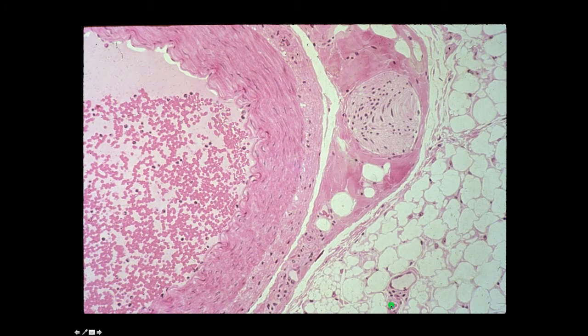Here is a peripheral nerve with some surrounding connective tissue, a lot of fat shown here, some small blood vessels, maybe an artery and a small vein here, and then a larger artery shown here. And in this larger artery, you can clearly identify something called the tunica intima, the internal elastic lamina, like so, the tunica media, which is mostly smooth muscle, and then the tunica adventitia. And you're going to come to appreciate that the tunica adventitia in these arteries blends with the loose connective tissue around the nerve. And you're going to, I think, remember from gross anatomy, oftentimes that blood vessels and nerves run together, and that's what you're observing in this particular histological preparation.